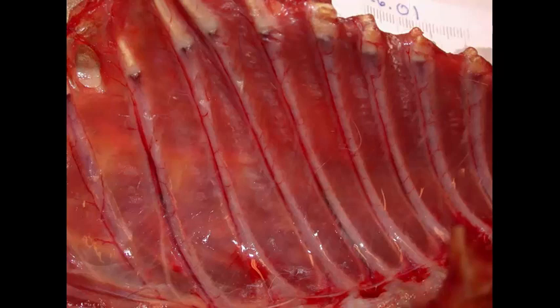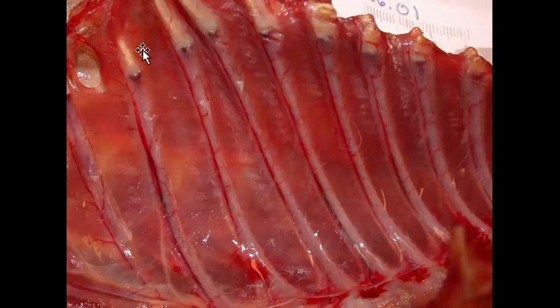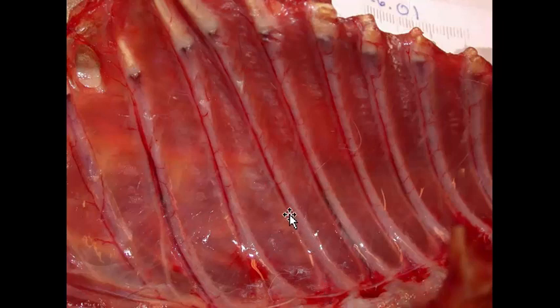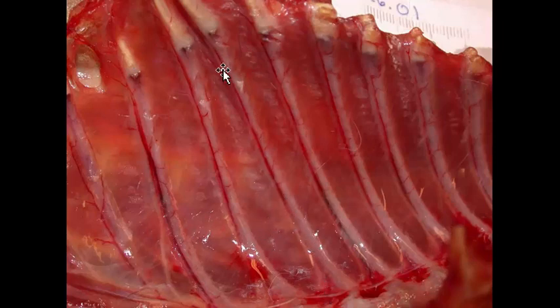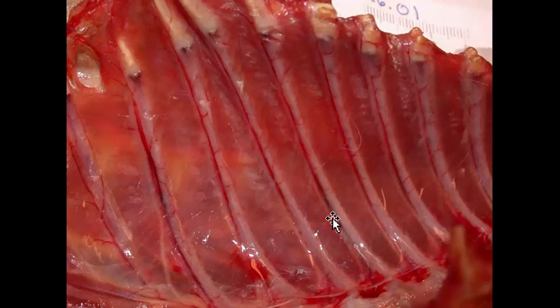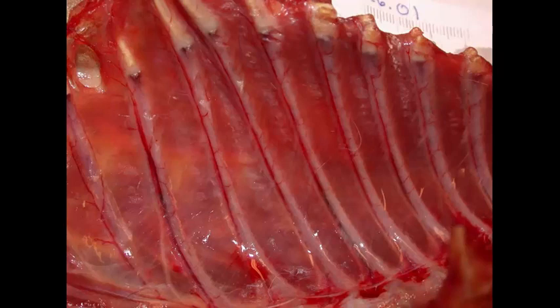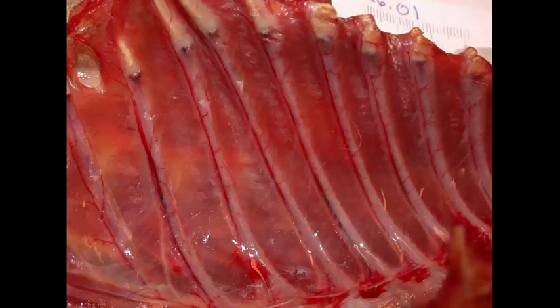Slide number one is tissue from a cat. I would like you to give me the morphologic diagnosis and the cause. Time's up. This appears to be upside down but I had to flip it. We're looking at the inside of the ribcage on the pleura, and there is subpleural mineralization of the intercostal muscles. That makes for a very good morphologic diagnosis. The cause is chronic renal failure. A lot of things happen in chronic renal failure — you can have a range of lesions resulting from vasculitis as a result of increased circulating urea nitrogen.